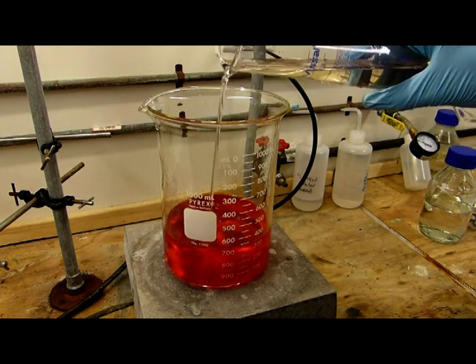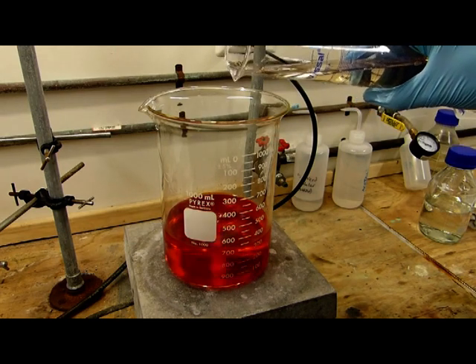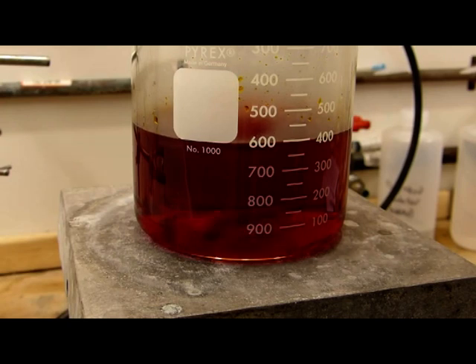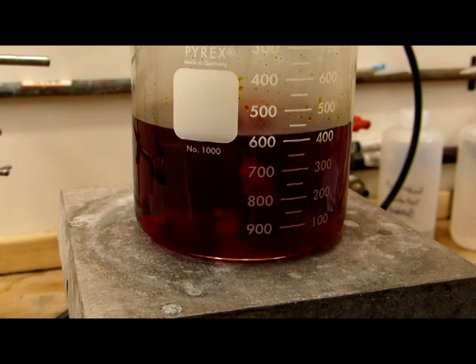It's going to take quite a bit to start, so we can go ahead and add a bit aggressively. You can see the color sort of reddens as the chromic acid equilibrium is favored. Getting very red now, which is a good sign. Sort of the same color as solid chromium trioxide. If you've ever cleaned labware you'll know that's also about the same color as chromic acid.